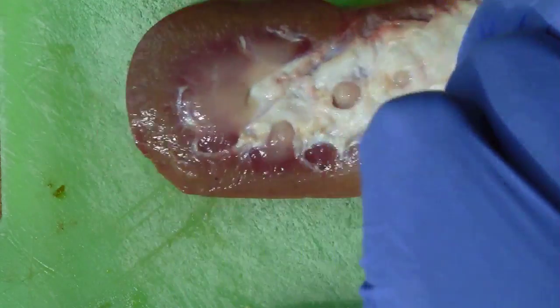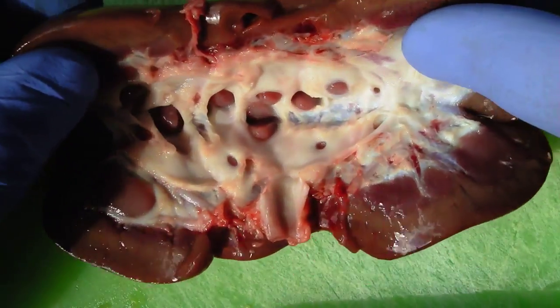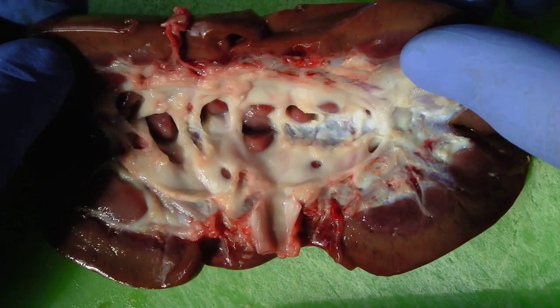Now I've got another sample. In case you're wondering, these are pig kidneys — they're not human — but pig kidneys are remarkably similar to humans.